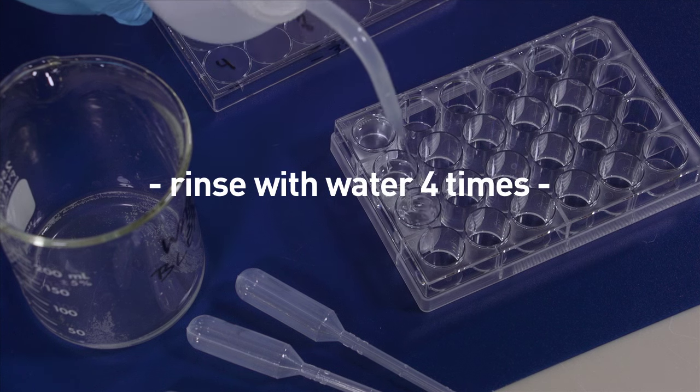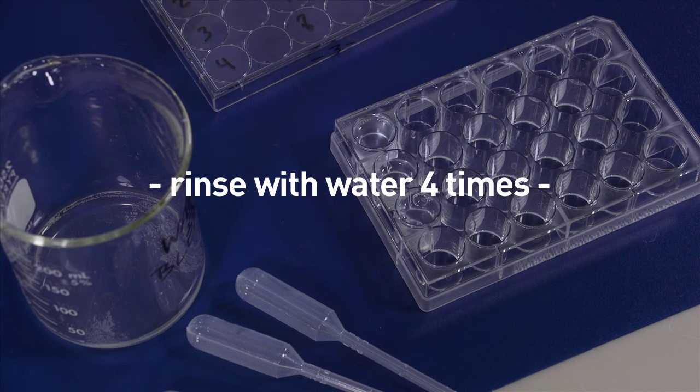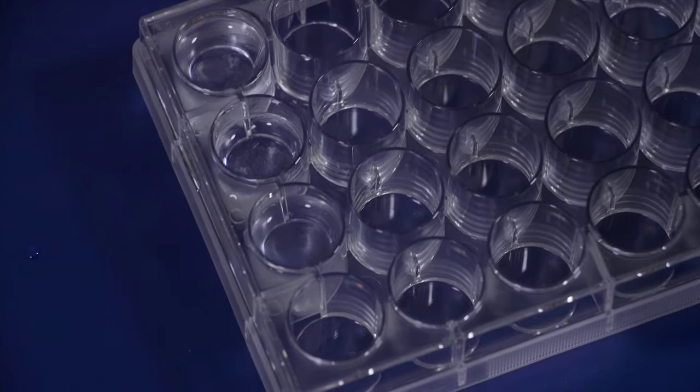Next we just add more water. We'll rinse these spicules four times. Once you've rinsed the spicules you should see a whitish film on the bottom of the well.